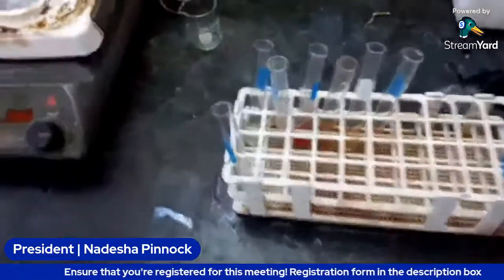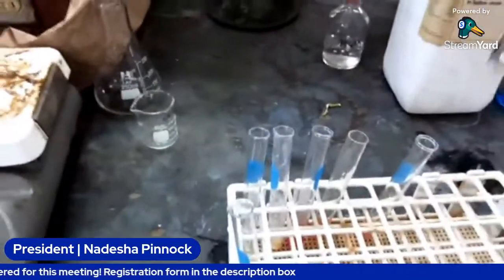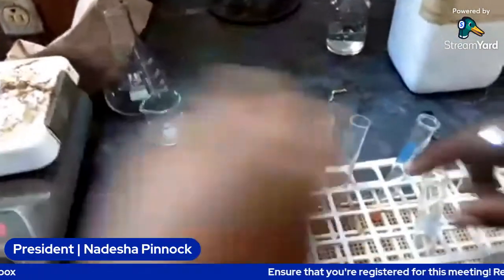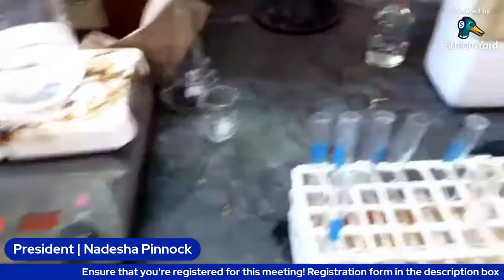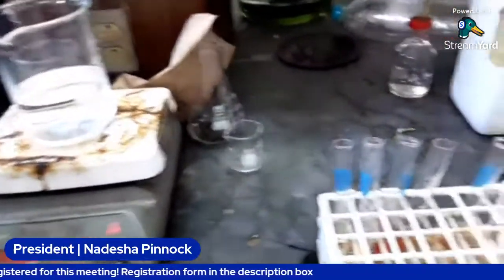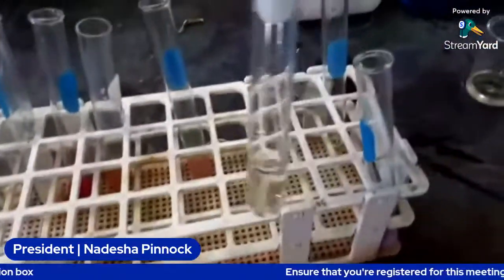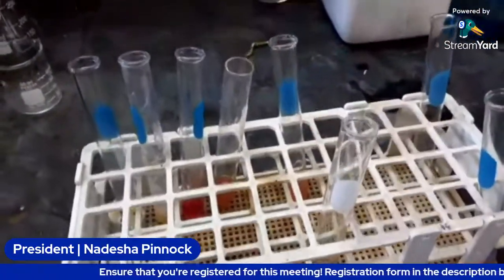All right. So here we are. We have our sugar solution here. This is the sugar, well, sucrose. This one. And we're going to make a glucose solution. So this is the sucrose right here, and then we're going to make a glucose solution.